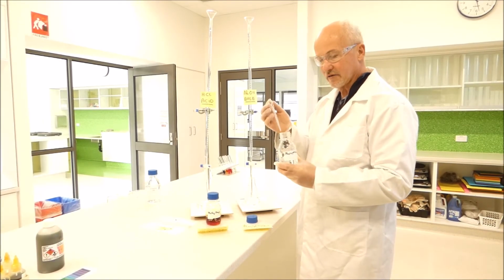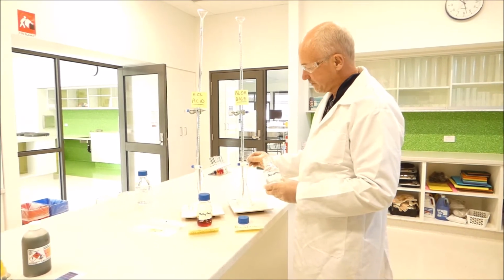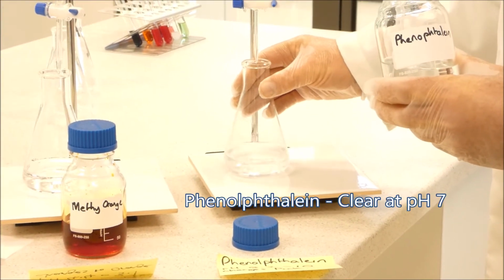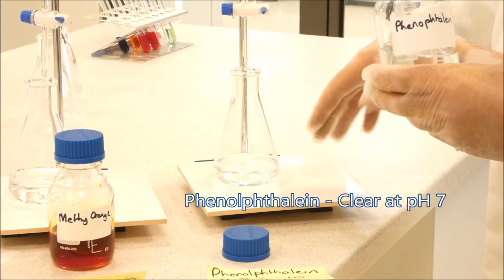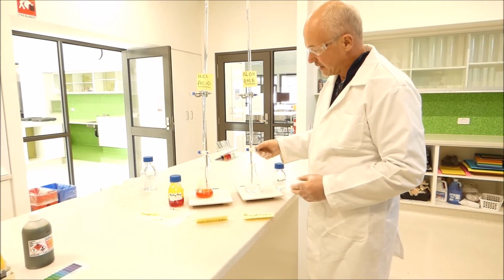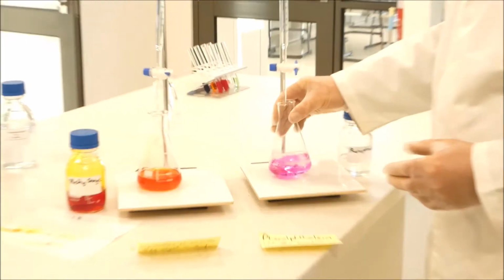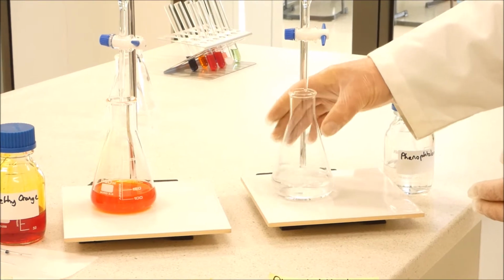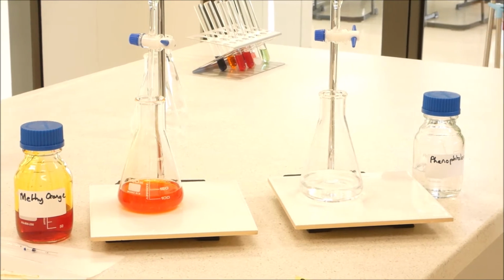So we're going to add our phenolphthalein solution to our conical flask of distilled water, and we should get the liquid staying clear, because this is an indicator that changes at about 8.2 pH, and the distilled water should be close enough to around 7 or 8 at most. Very slowly add sodium hydroxide to the phenolphthalein, and we're going to stir it. And you might have noticed it went pink for a short while and it's gone back to clear. That's because phenolphthalein will only change once the pH gets to at least 8.2.